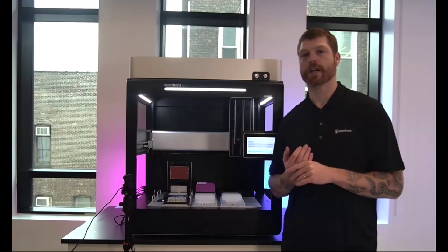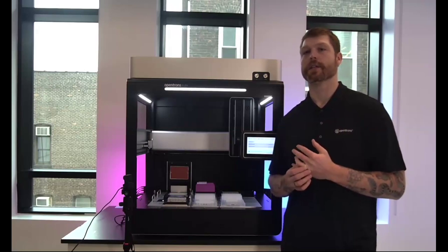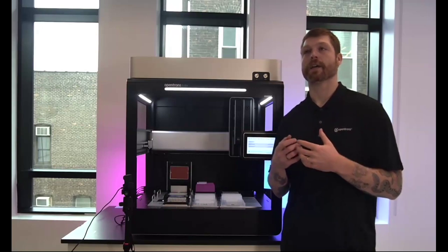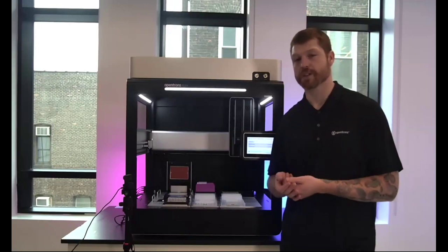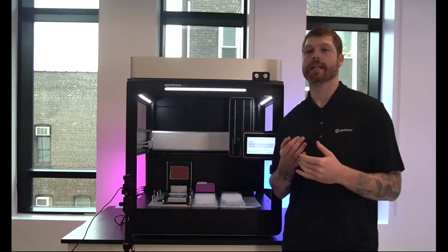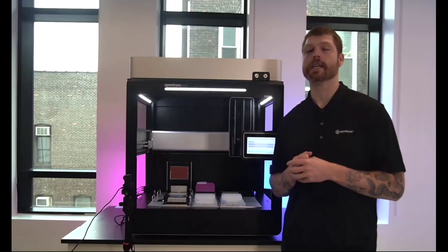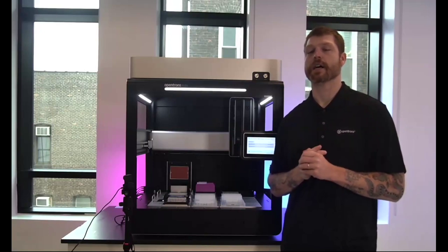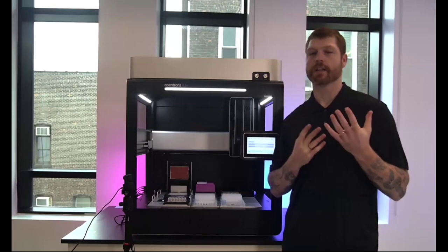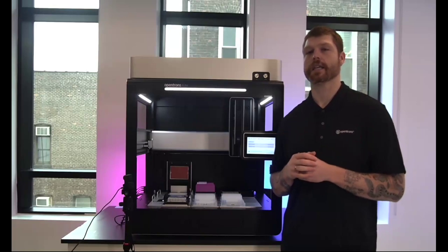And then just as a quick plug for the future, in future releases, we will debut the ability to do pipetting relative to the liquid height that we found. So you can specify to find the liquid height and then pipette, say, 2 millimeters below it, as is industry standard. And in a feature to follow that as well on our roadmap, we'll have the ability to track in Z as well. So to continually move down depending on the volume of liquid and the geometry of the labware. So again, the first feature set, but it plays very nicely with the error recovery options, and it's just further utility of the Flex in your workflow.